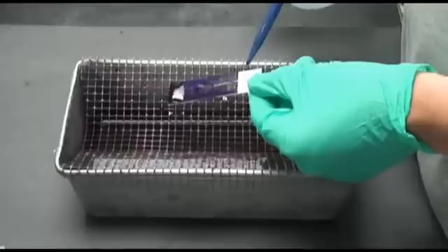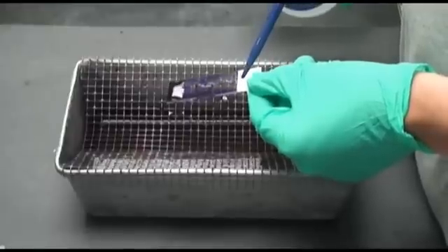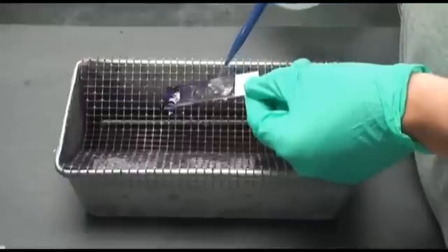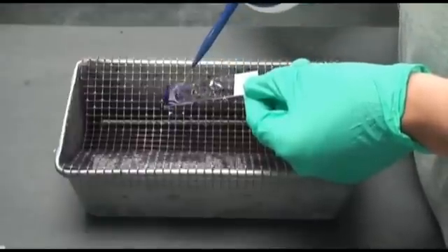It is not necessary to dry the slide until the entire Gram Stain is complete. Make sure to repeat this washing process between each stain.